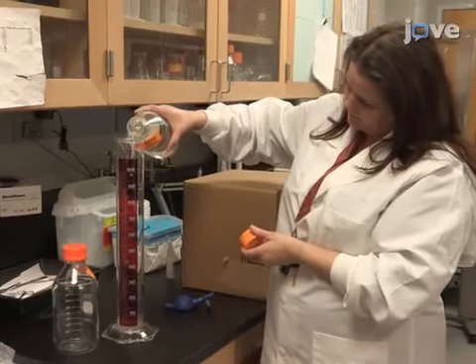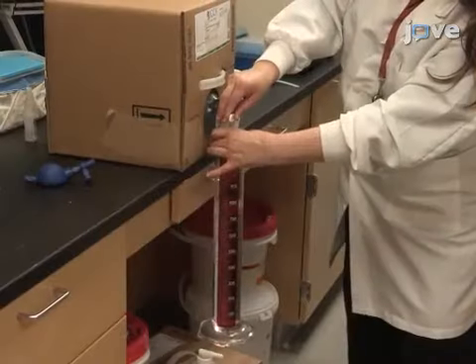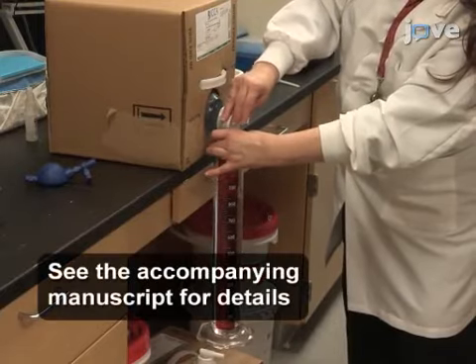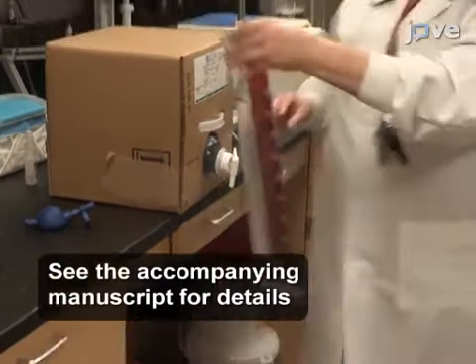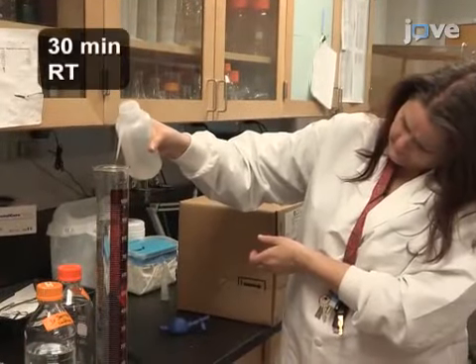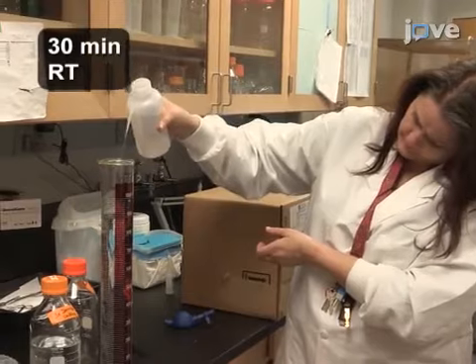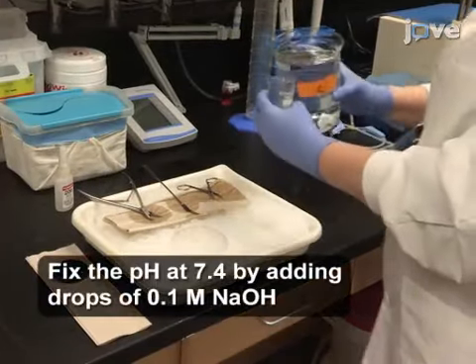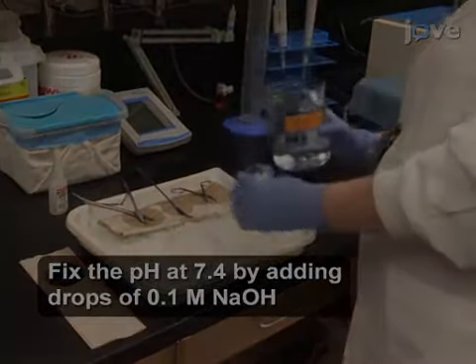Next, prepare sucrose ACSF by preparing stock solution C. Before each experiment, mix 300 milliliters of stock C with 600 milliliters of distilled water and oxygenate it with carbogen at room temperature for at least 30 minutes. After that, transfer 100 milliliters of sucrose ACSF solution to a clean beaker.